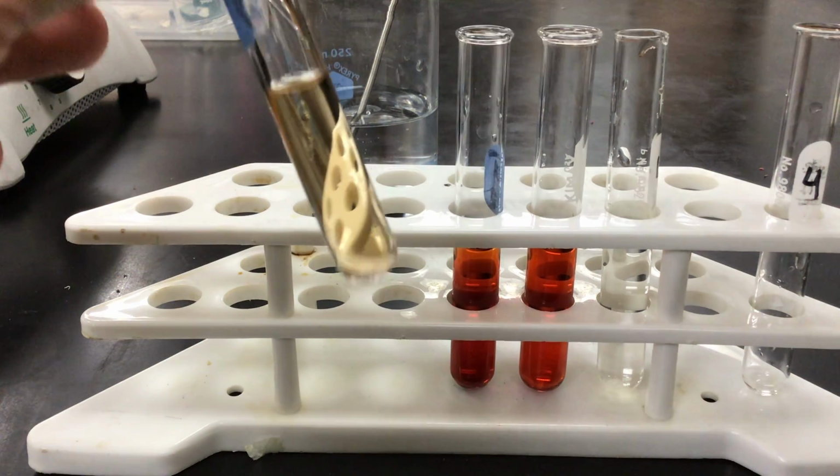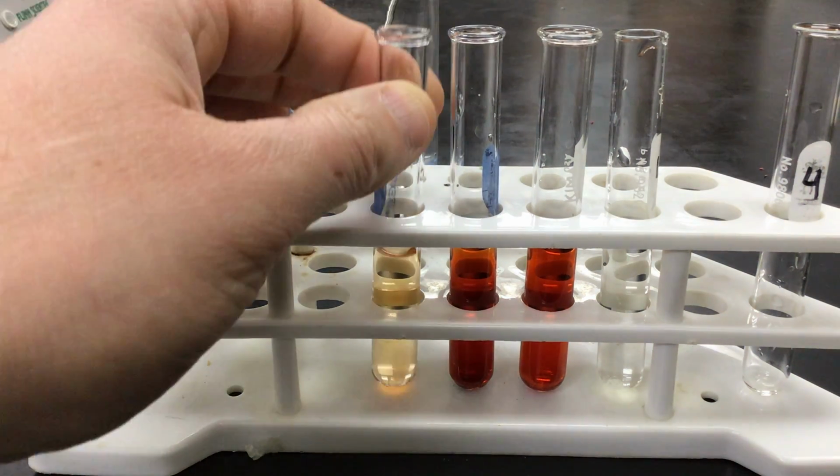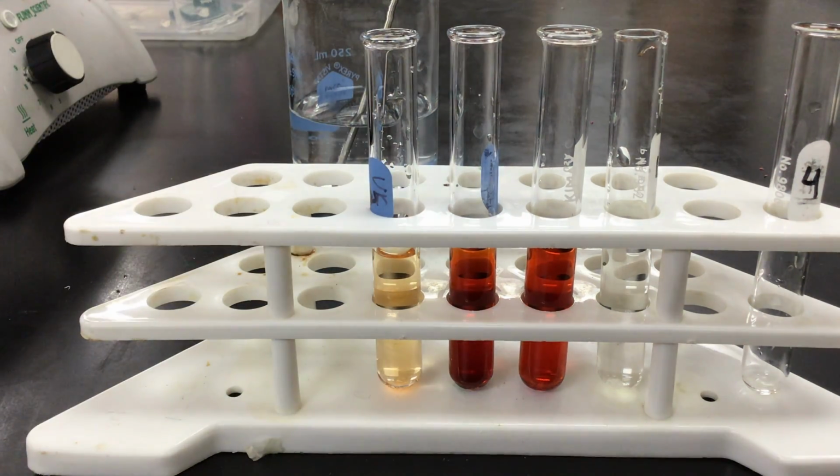So mark those observations down in the data table. And then the key thing in all of these is to be able to provide a good, solid explanation, something that you could use in the national exam or the test in this unit to be able to get full credit for why these observations are occurring when I cause these different stresses.